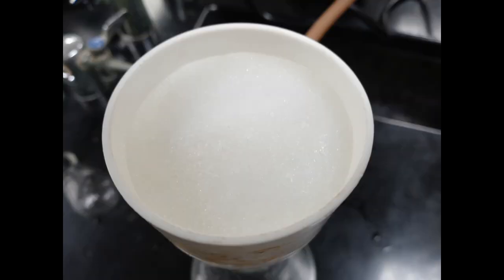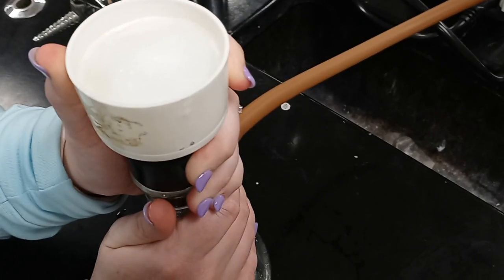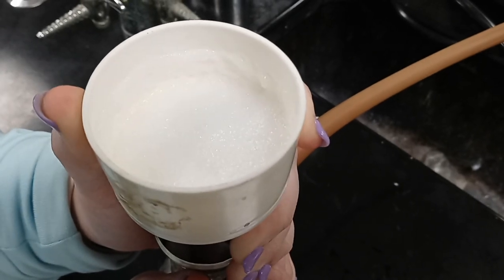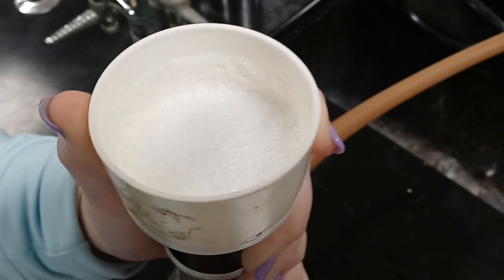An R-squared value was determined to be 0.9986. The formula leads us to a concentration of 3.145 times 10 to the negative 4 molar.